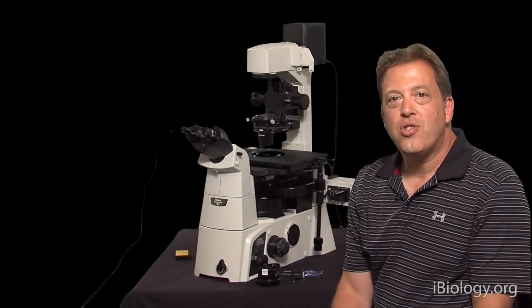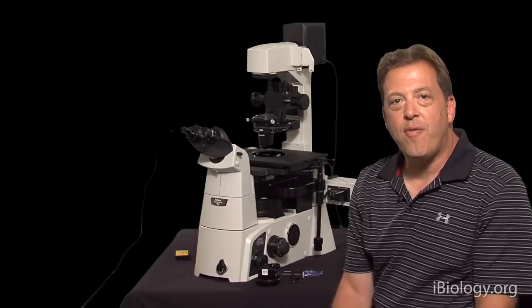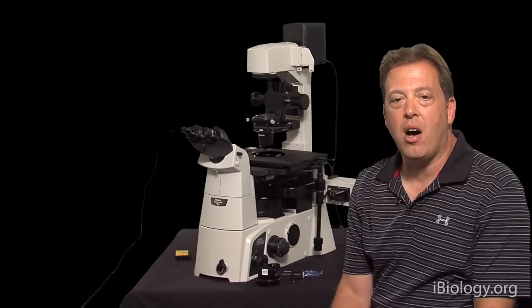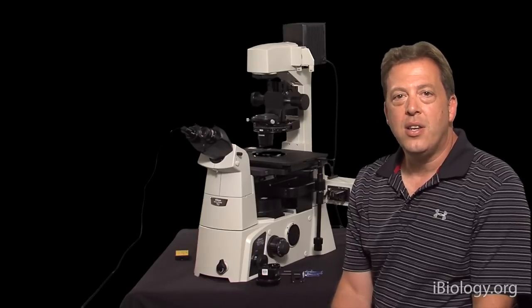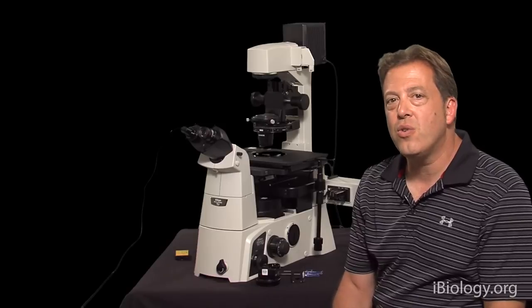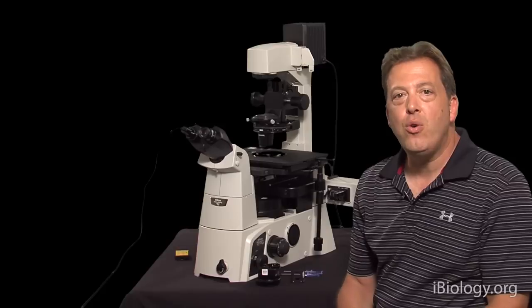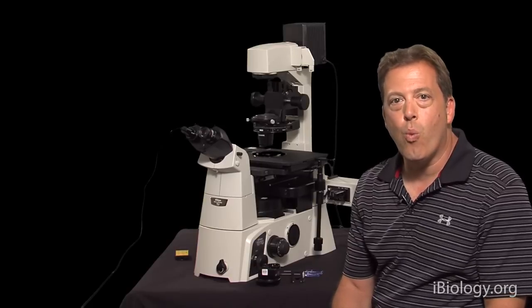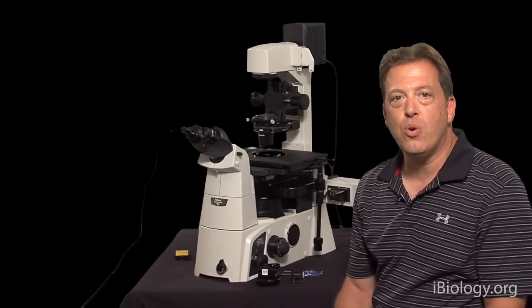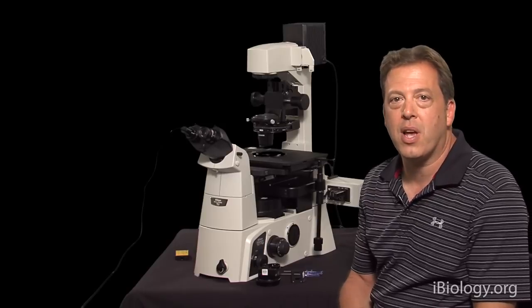Hello, I'm Steve Ross, General Manager of Product and Marketing for Nikon. Today we're going to follow up on some of the previous lectures, specifically on polarized light, differential interference contrast or DIC, and phase contrast. I'd like to give a more practical view of how you actually get these techniques to work on the microscope, what the components are, and how you adjust and troubleshoot them for practical applications.